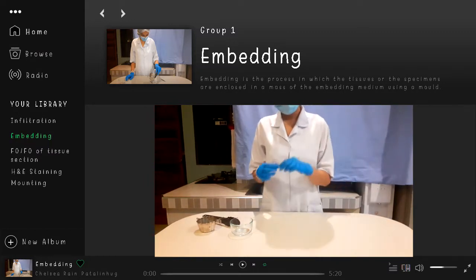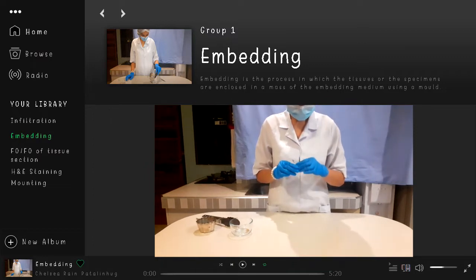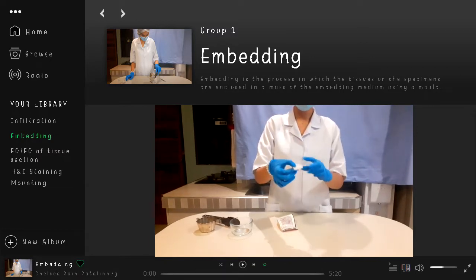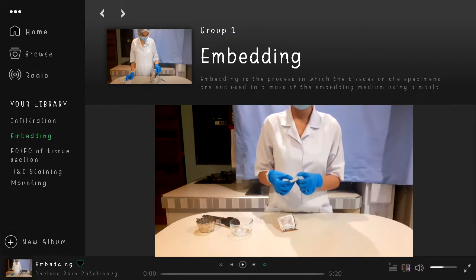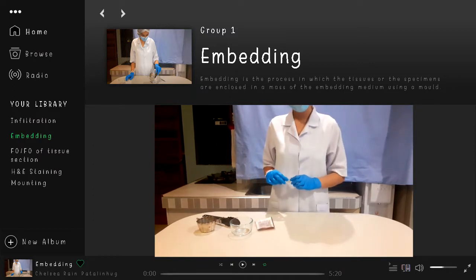Now that our melted paraffin has completely dried out because of the room temperature, we will get it now. So this is our cell block that we will use so that we can cut this in the microtome properly. Okay, so that's it for our embedding procedure.